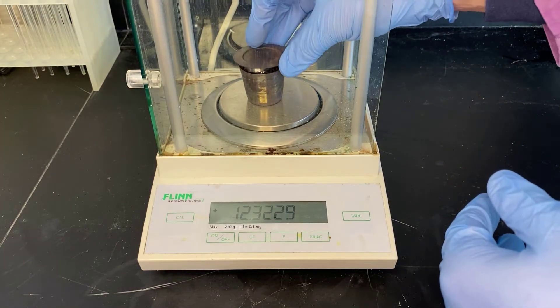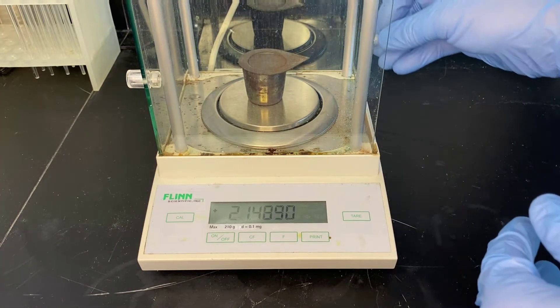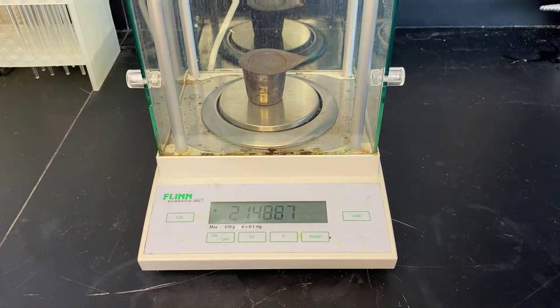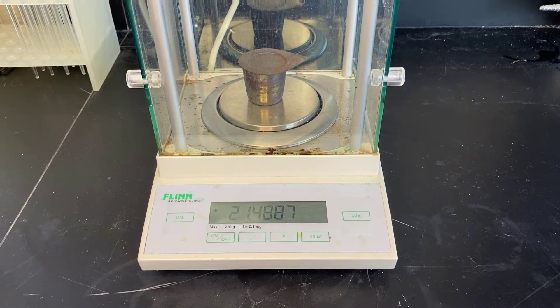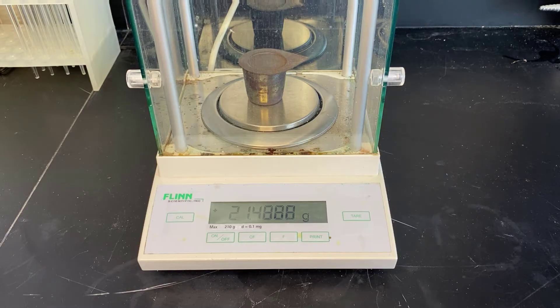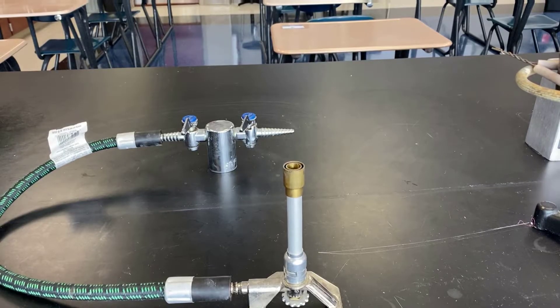Let's go ahead and put the lid back on and get the new mass. Right now we have two out of the three masses that we need. The big issue will be how careful we are as we do the lab where we roast and heat the magnesium.